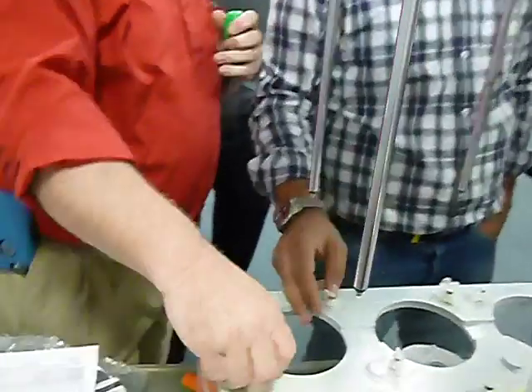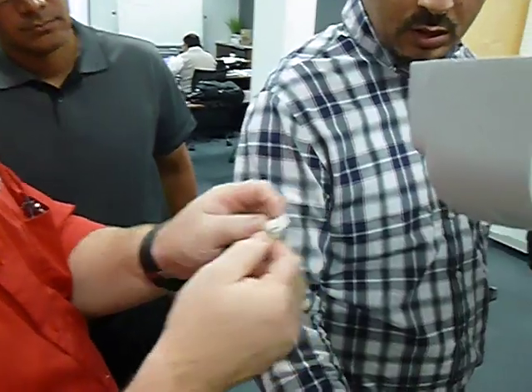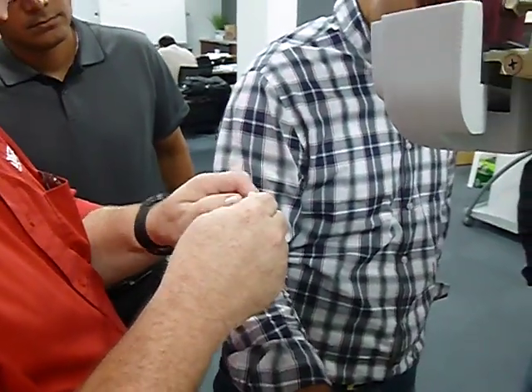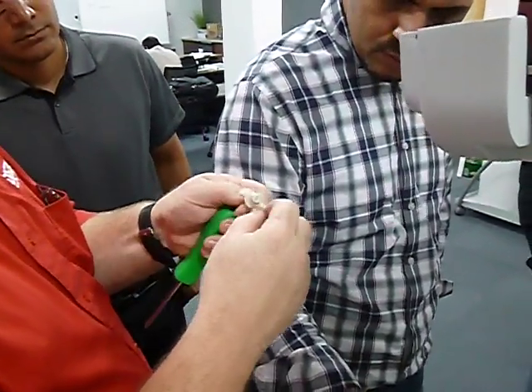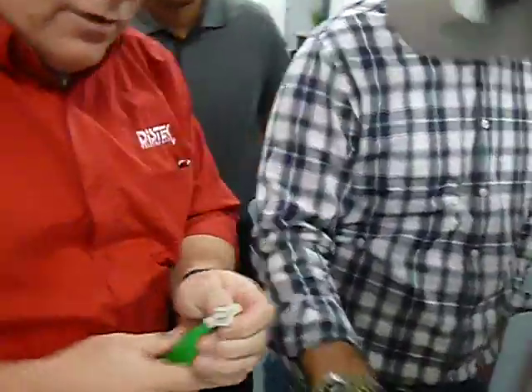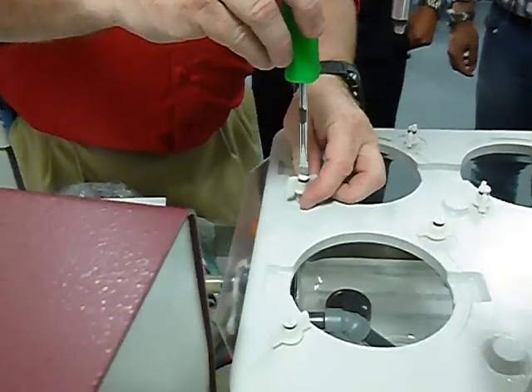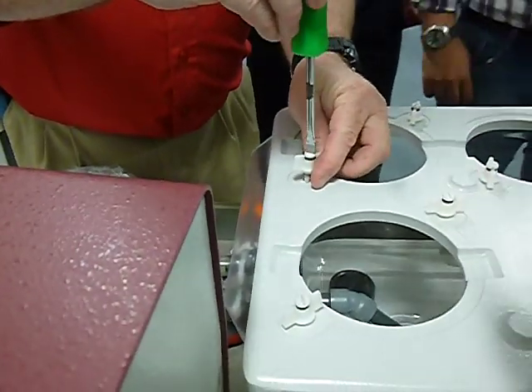Yes. The problem that causes it to spin like that is this. See this right here? This nut here. This nut gets compressed too tight up against there. So if you back this nut off a little bit, that should allow this to freely move around. And then you can put this back down inside here, and it should operate properly. Should. This could be old and need to be replaced. We'll see.